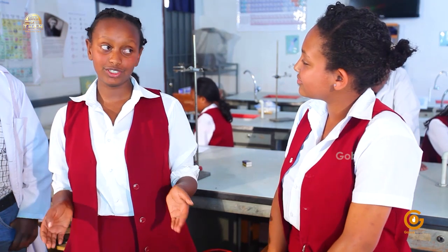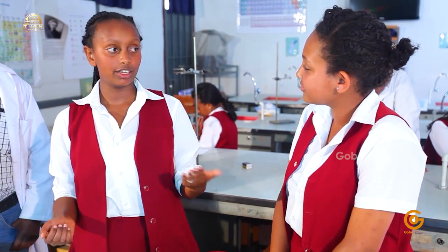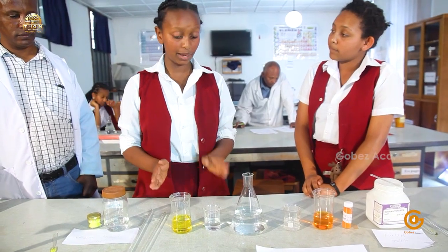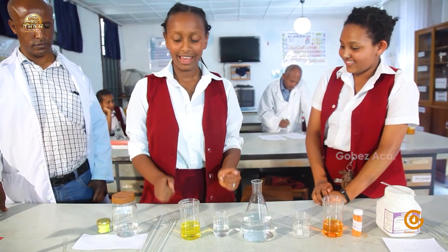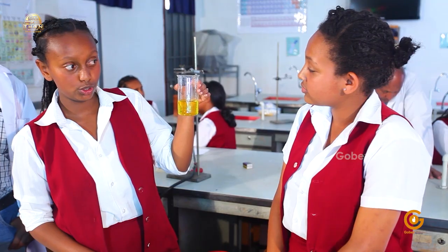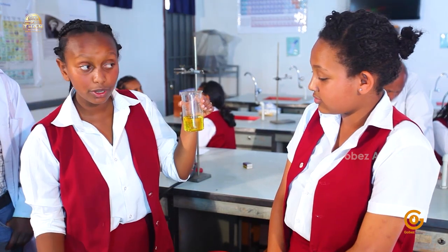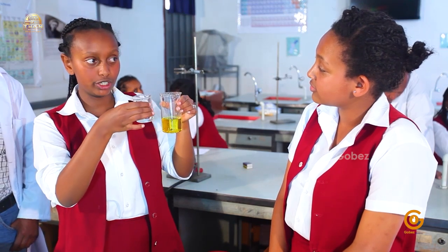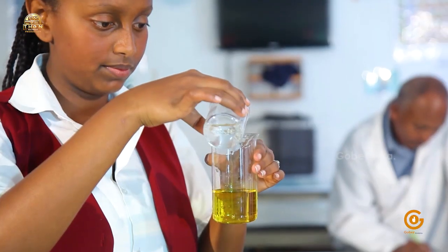and we have introduced our instruments to our audiences, let's go ahead and proceed with our experiment, shall we? So I'm going to mix together the chemicals that I have prepared here. Now I have here a beautiful yellow potassium chromate solution, as you can see. So I'm going to take my hydrochloric acid and I'm slowly going to pour it into the solution. Let's see what happens.